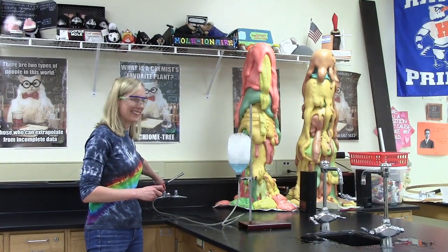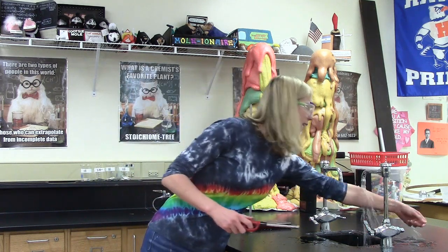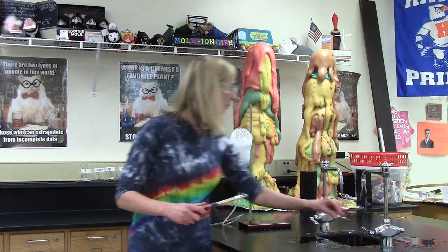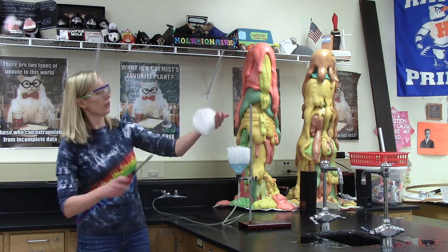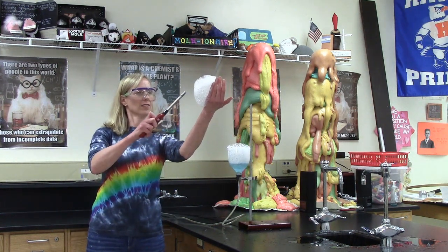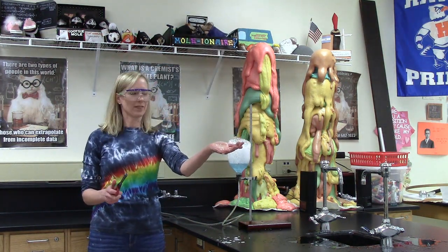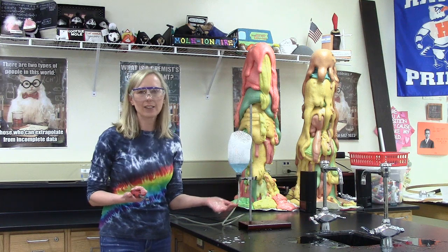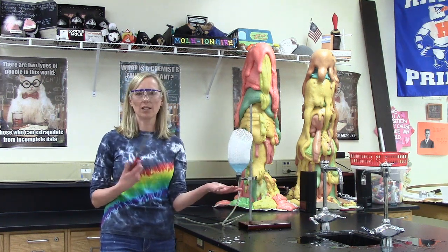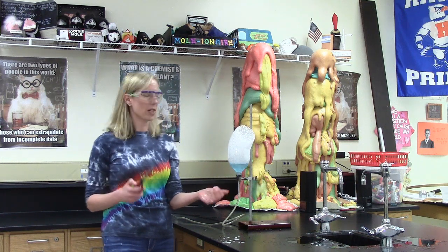They're growing. Okay, here we go. We're going to try it again. Lots of water on my hand. Scoop. And it ignites. So every time we light that on fire, we're getting a very exothermic chemical reaction. A lot of heat is produced, which is why the water's on my hand, kind of a barrier to protect my skin. And we're producing CO2 and H2O.